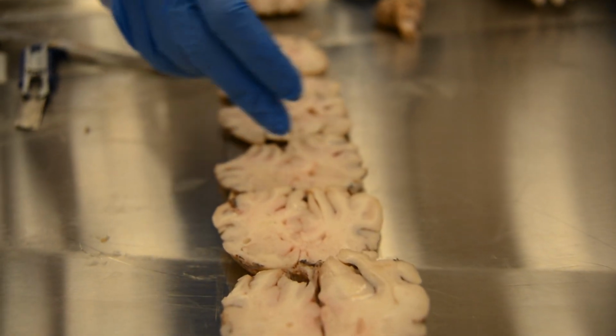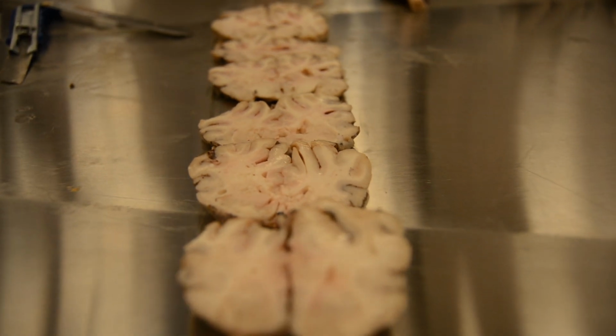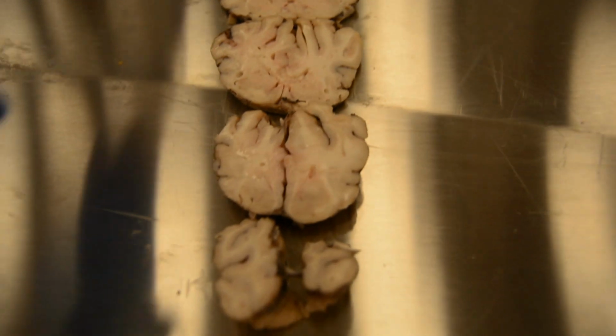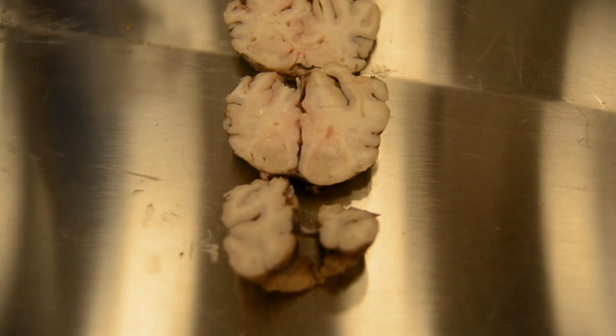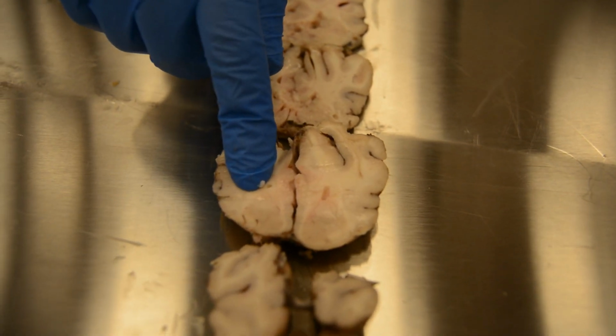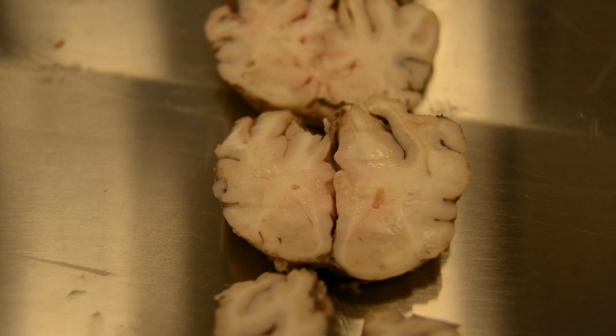I found the basal ganglia fully developed, or most of the basal ganglia at its middle, and when I took my cuts to the frontal lobe, I find the basal ganglia even evident in my second cut, which is different from a human's brain.